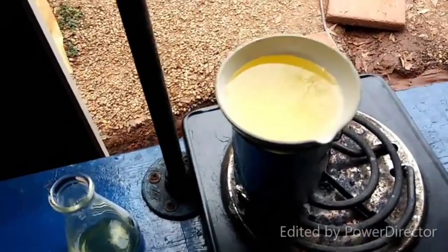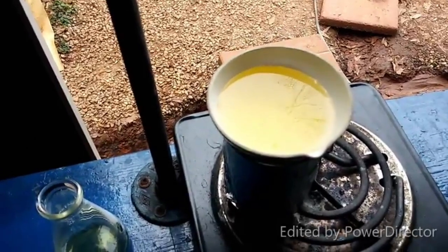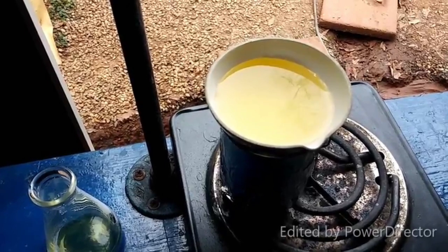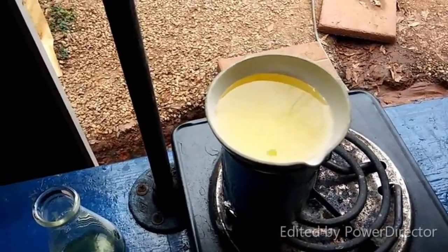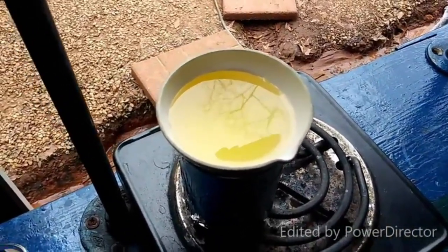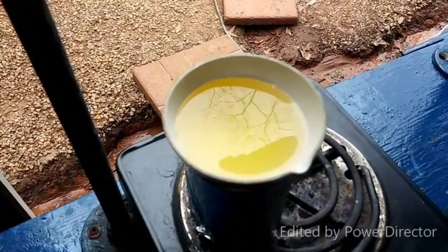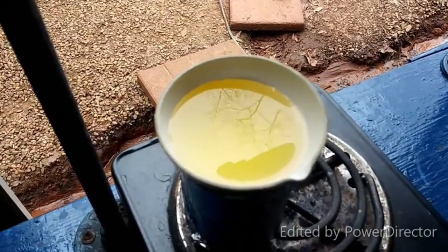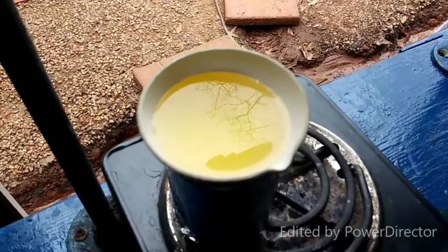So, like I said, I missed showing you guys all of that because it was such a mess. I very nearly decided to just completely scrap it, and then I said, well, no, because this looks nice, and I will evaporate this down until I get a crystalline product. I mean, you didn't really miss anything. All that happened was that kind of turquoisey, bluish, grayish mess all dissolved in the potassium cyanide solution to produce this.